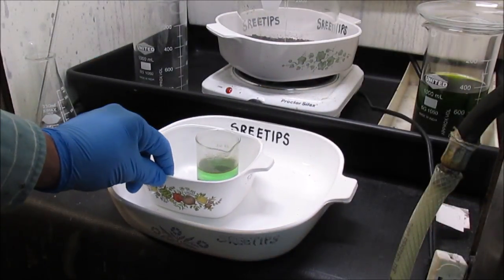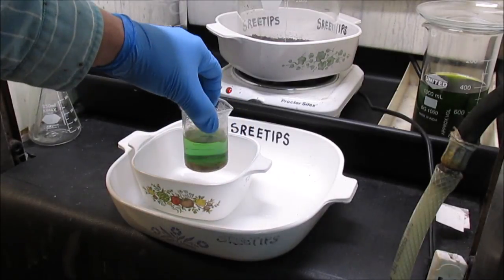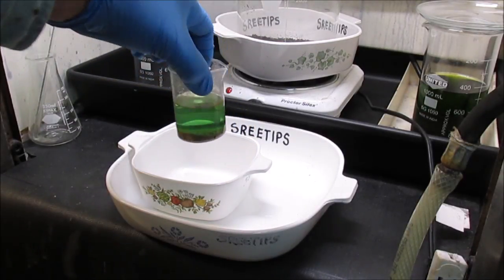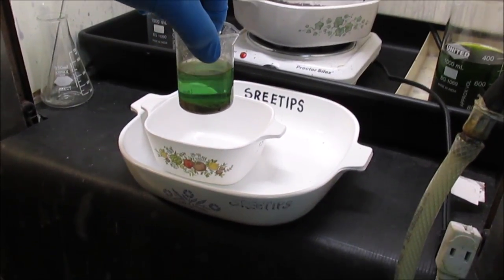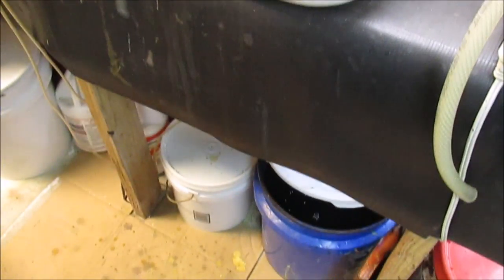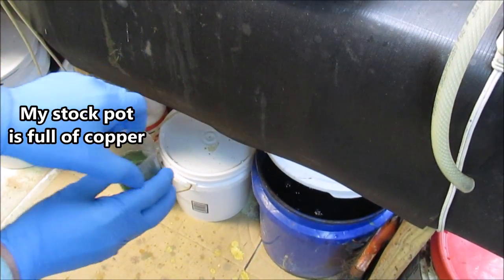I'm going to commit this solution to my stock pot. I don't think it will cause a problem there, but the solids I'm going to go ahead and just empty right into my waste treatment.